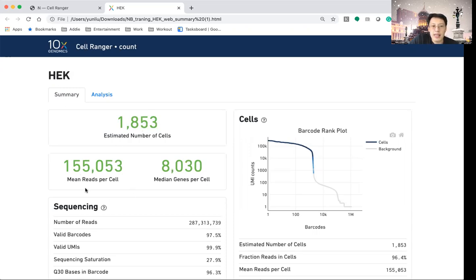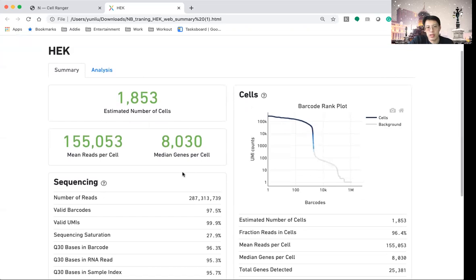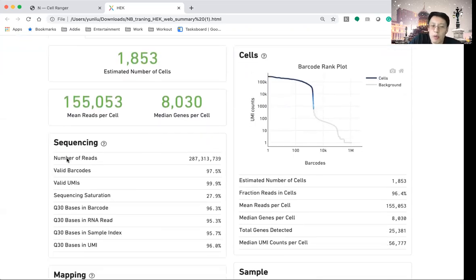The next one is the number of reads per cell. So you can see a lot. And then the number of genes that are being identified per cell. This is one of our earlier data sets during the training. Then we will also look at the number of total reads. In this case, it is about 287 million reads. And you can see that 97% have a valid barcode. Remember that the barcode is the one corresponding to individual cells.